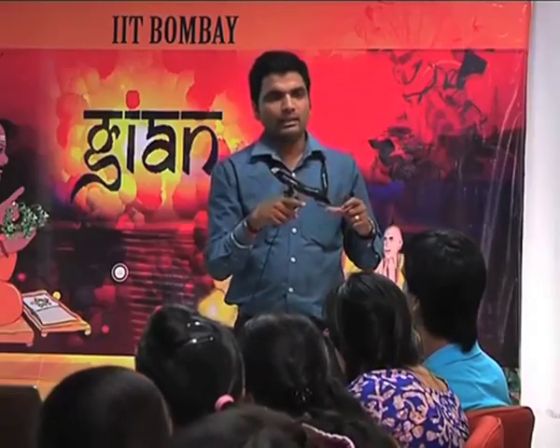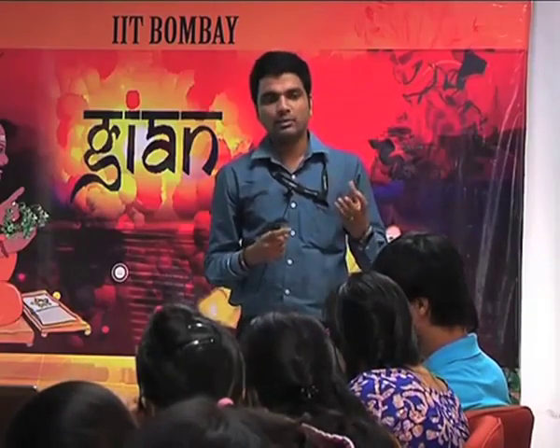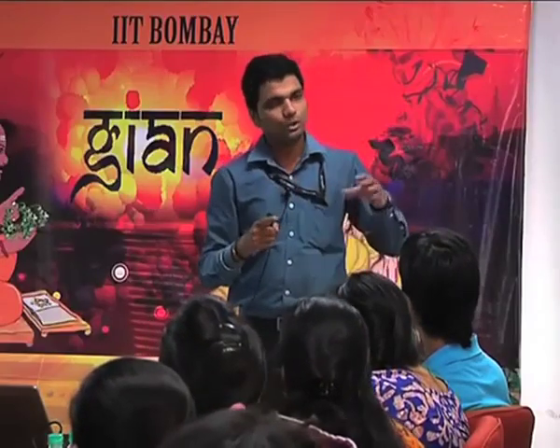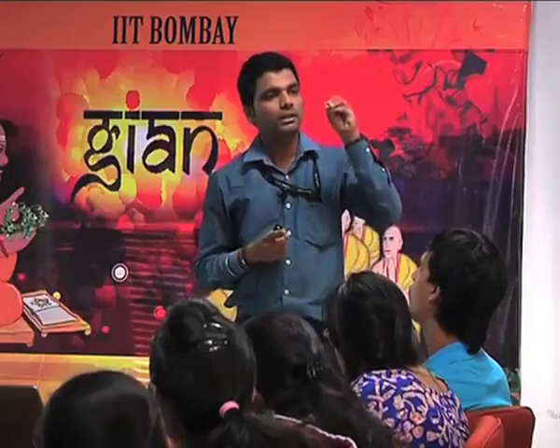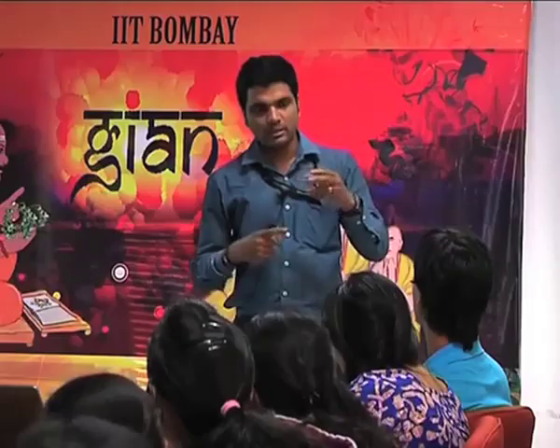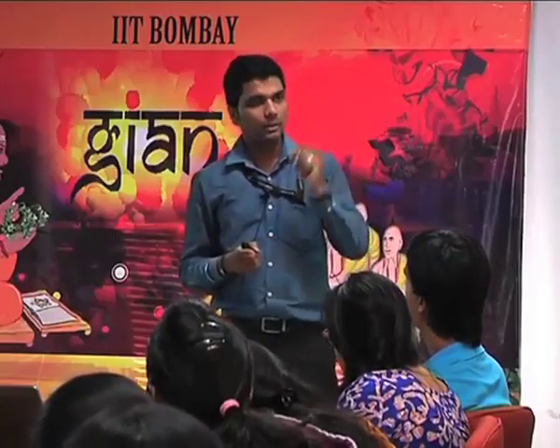Then it moves forward due to the RF voltage, and those ions which get destabilized move out and go to the vacuum. Like that, the ions move between these rods, and by providing a particular DC voltage, you are stabilizing ions of a particular mass-to-charge ratio in the quadrupole, and the rest of the ions get destabilized into the vacuum. That way you can select the particular compound of interest.